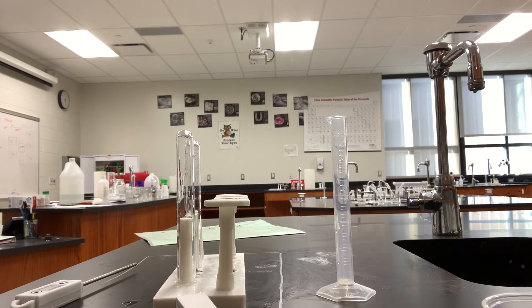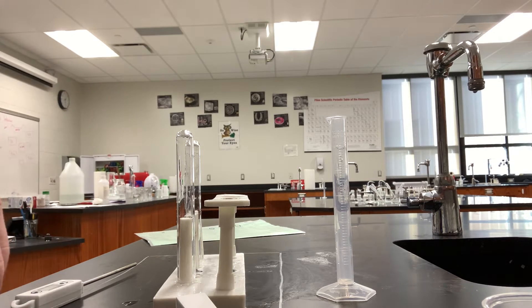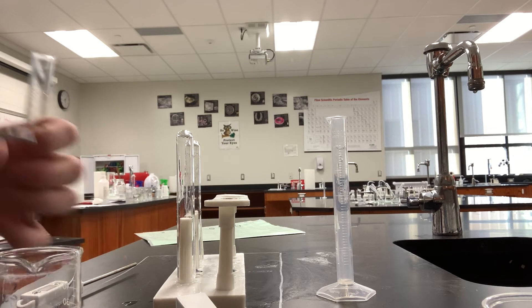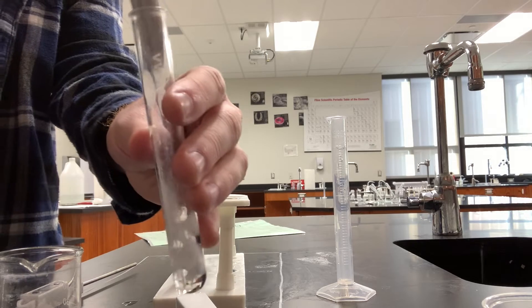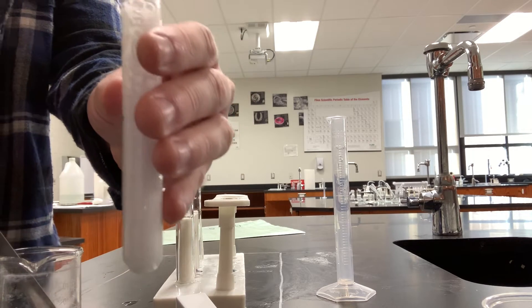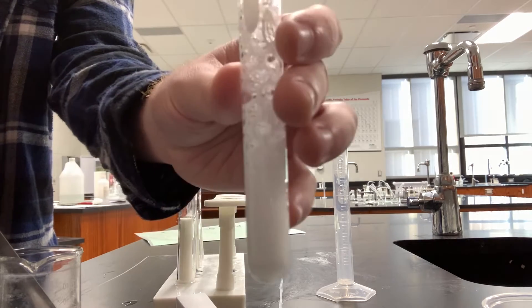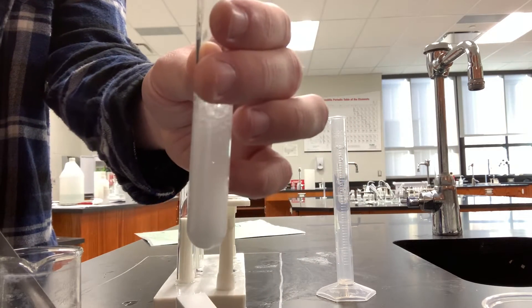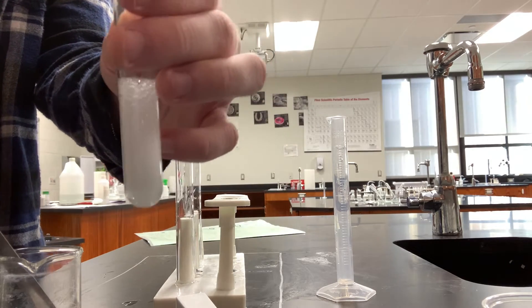Now we're going to add a bit of sodium bicarbonate into the acetic acid. It's going to fizz up. And if we check the temperature of that.